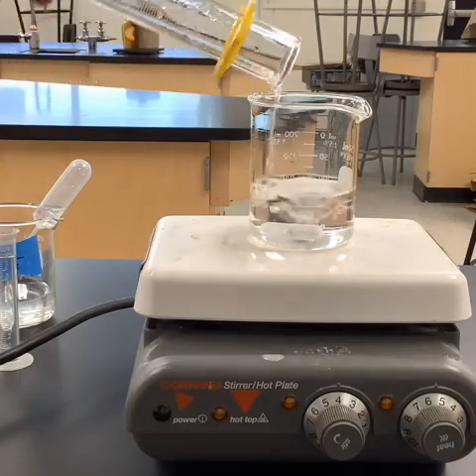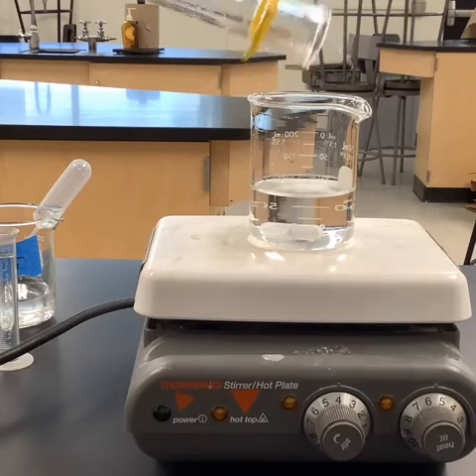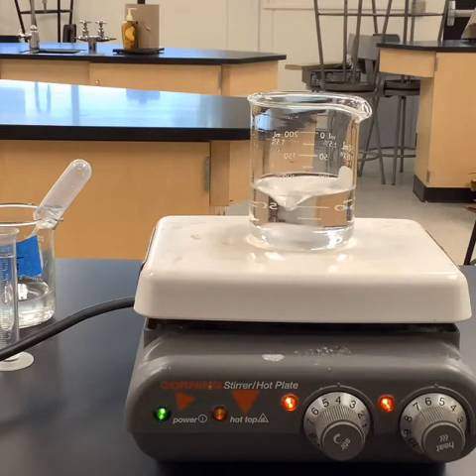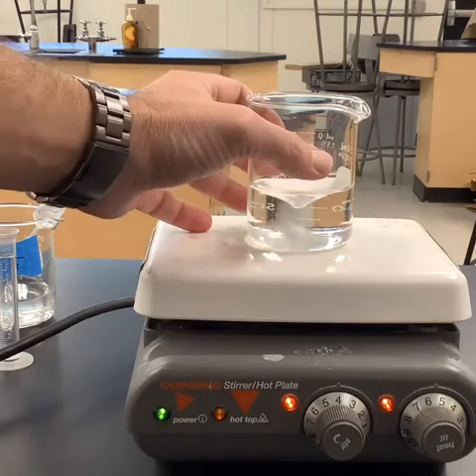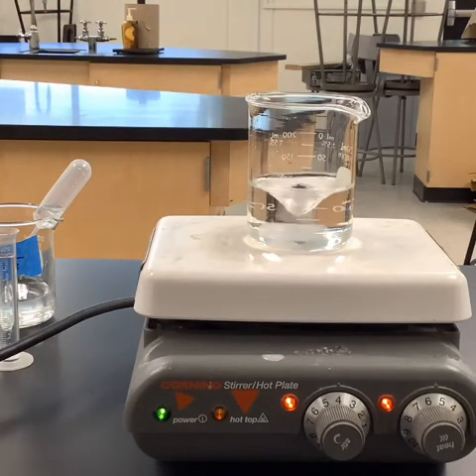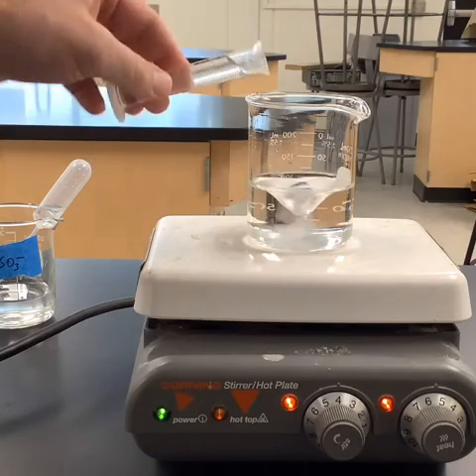And then once again, I didn't turn it off. I just unplugged it to keep the dial exactly where it was. Get that last drop in there. So let's plug it back in and get it stirring. Okay, we've got some stirring there. We're going to go ahead and get ready, so make sure you have your stopwatches ready. And we've got the constant one, the 10 milliliters. So hopefully we can start it at the same point. I'm going to dump it on 3. 1, 2, 3.